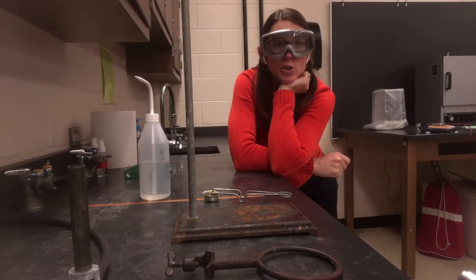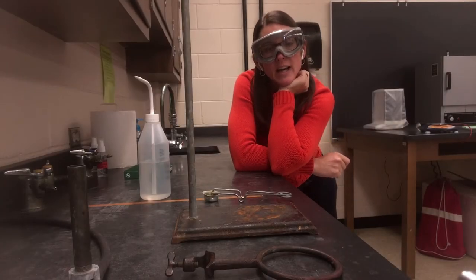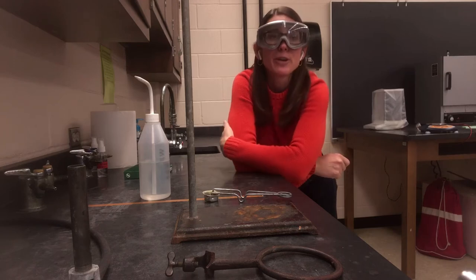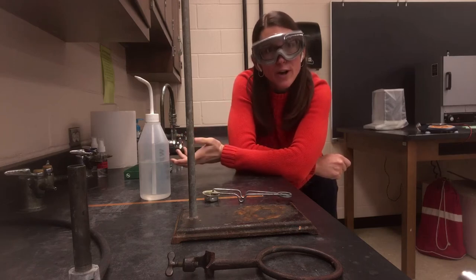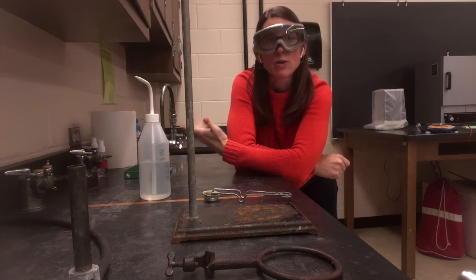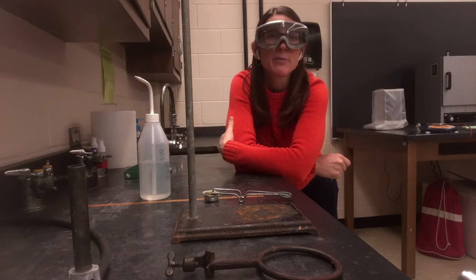Hey there folks, I wanted to walk you through the process of setting up a ring stand in preparation for heating. Maybe you have a beaker full of water you need to boil, or you need to evaporate water away from something, or you need to heat something that's going to have to rest above the flame.